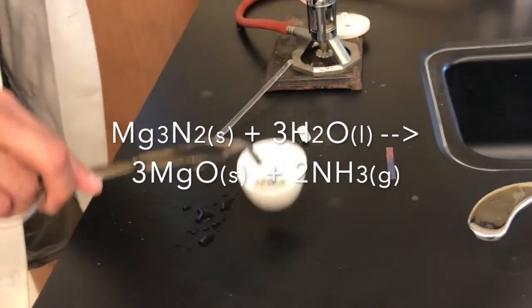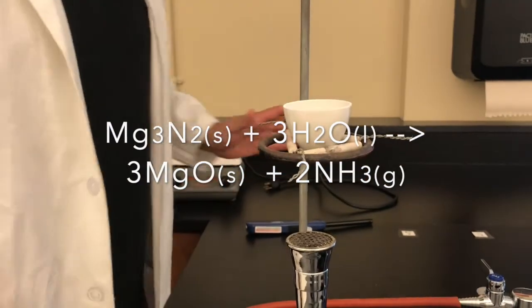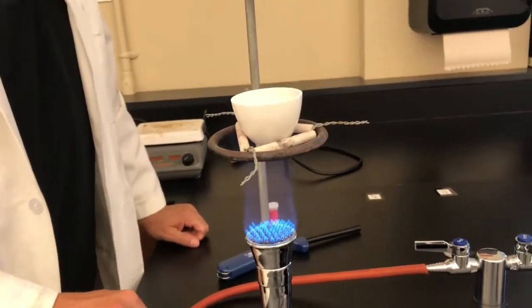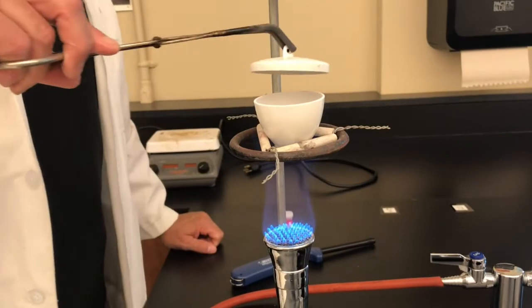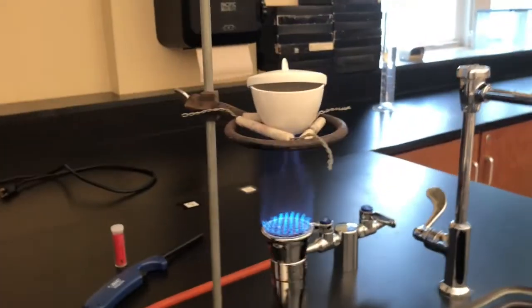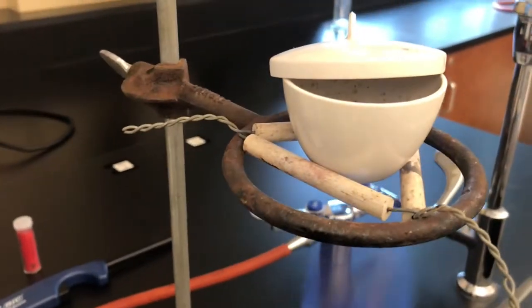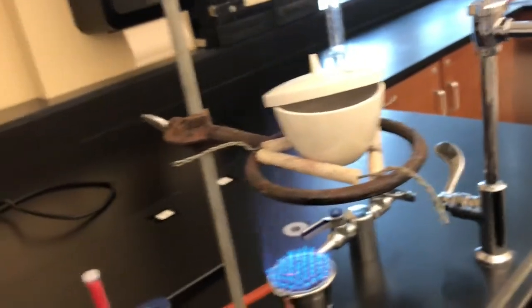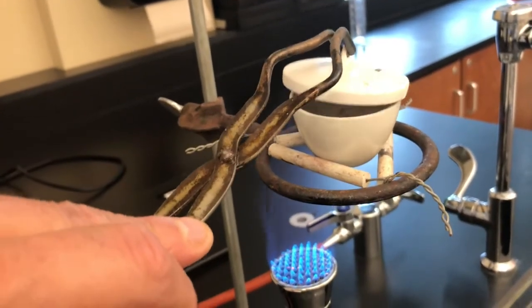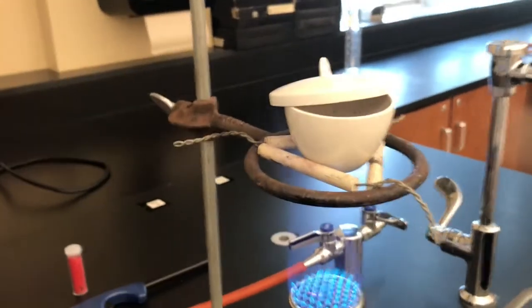So now what we need to do is heat this — we want to drive off the water. The magnesium oxide — the product — is going to stay right there. So we're just going to drive off the water. I'm going to put the crucible lid just kind of right there, because we don't want the water to boil and allow some magnesium oxide to leave the crucible. I got a little carried away with how much water I put in. Crucible lids are designed to sit on crucibles like that. Let's heat this up for a little bit.